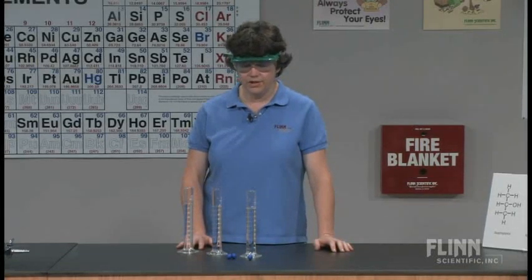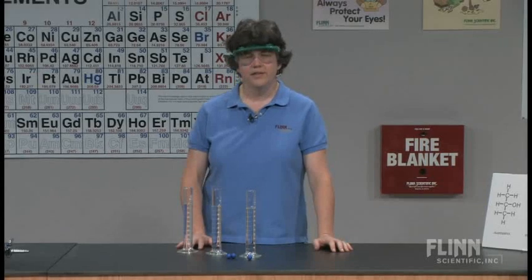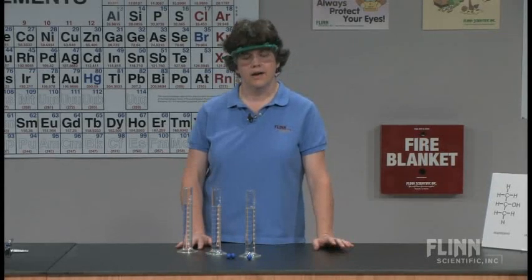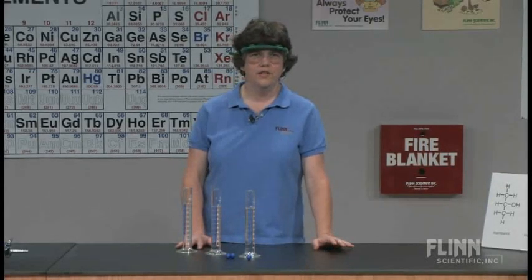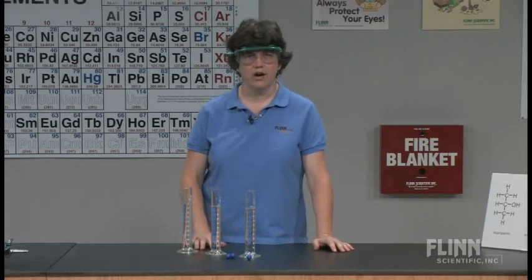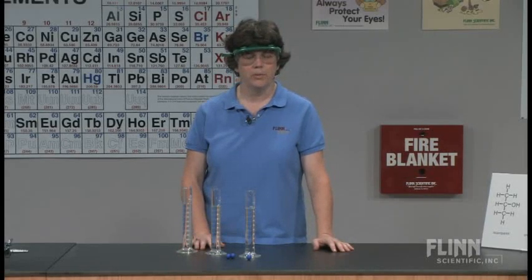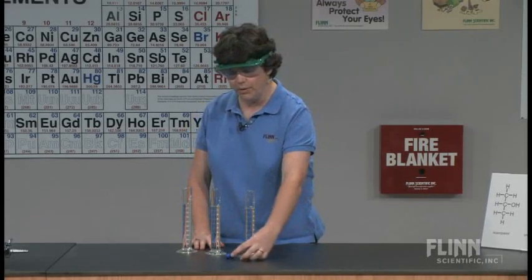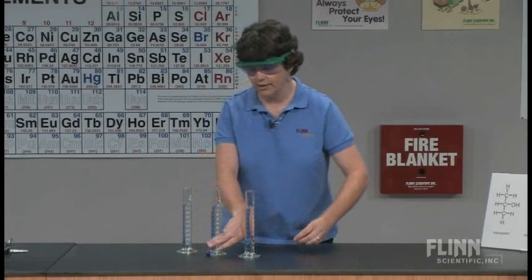Another issue is that depending on the polymer the balls are made out of, they could dissolve in one of the liquids — such as the propanol. These ones tend to work pretty well and I've already got them set the way I want them.